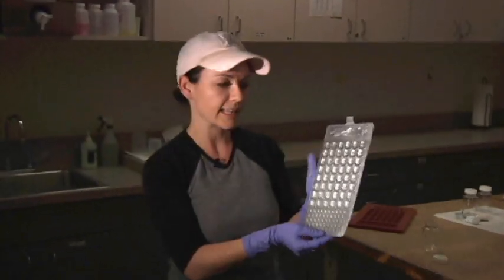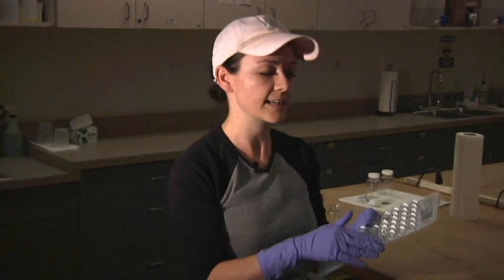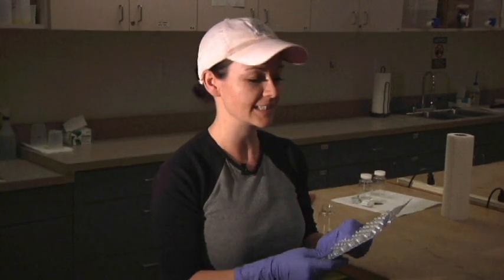That's what it looks like. Then we'll put the cell in an incubator, which keeps it at a constant temperature for 24 hours. Then we'll come back and stick it under a UV light and see if there's E. coli present.